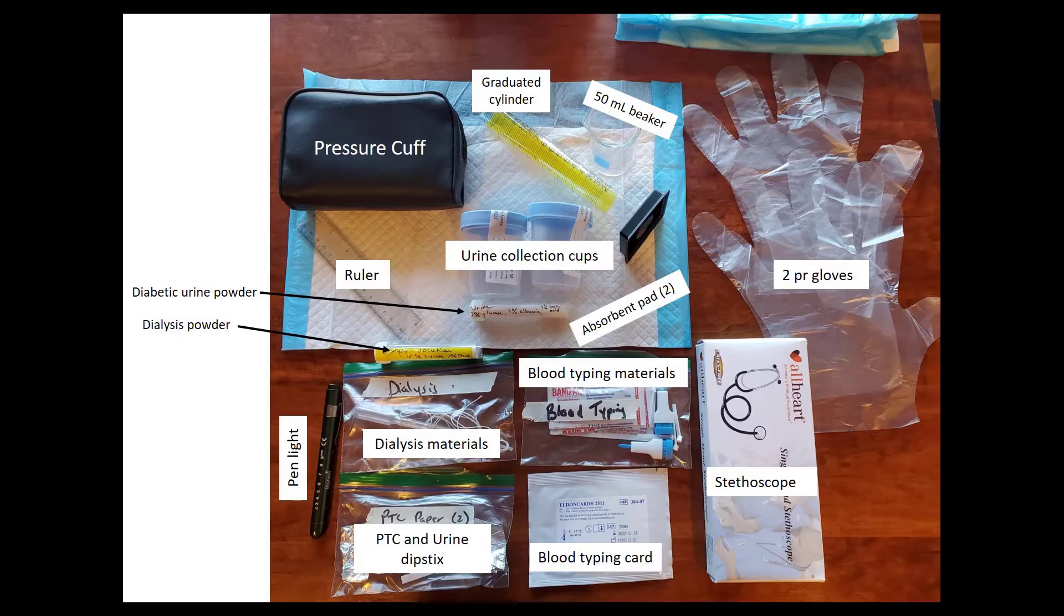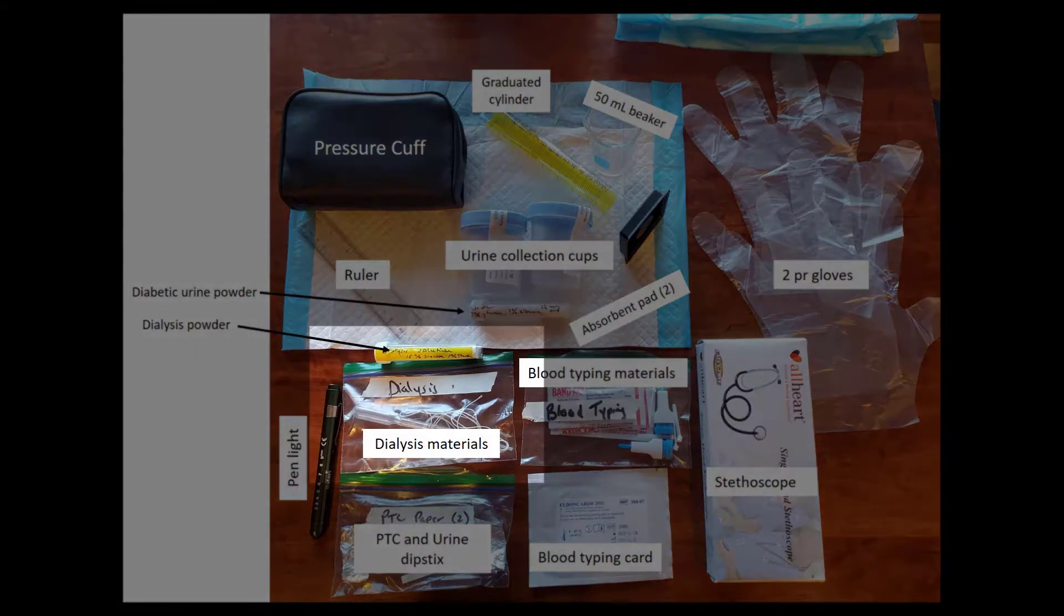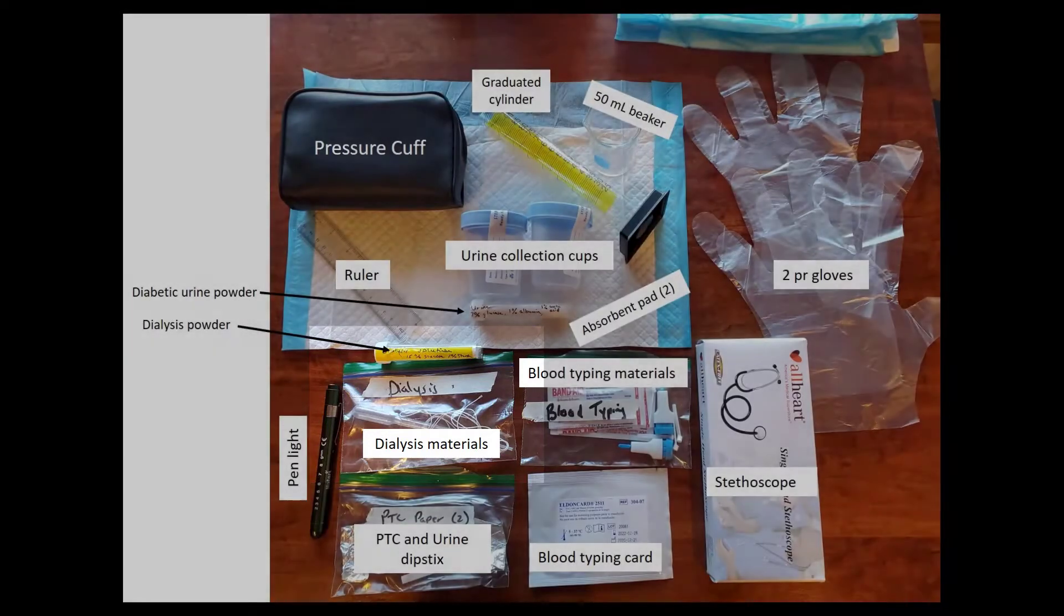You're going to need to pull out the plastic bag that says dialysis on it. You'll also need a test tube that says dialysis. Now there's two test tubes in there, make sure you get the one that says dialysis or dialysis powder.